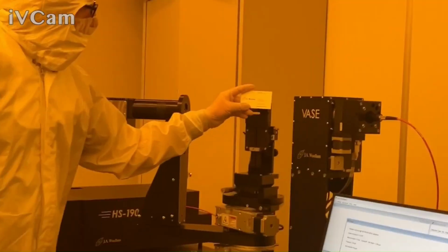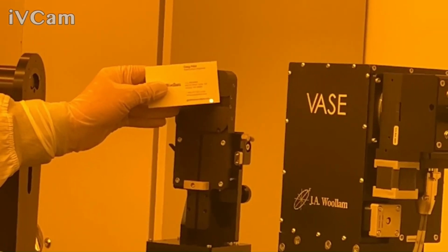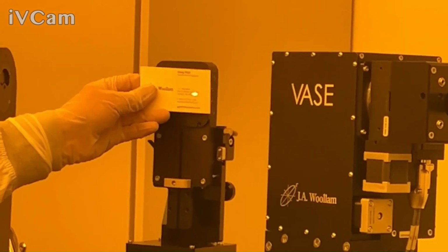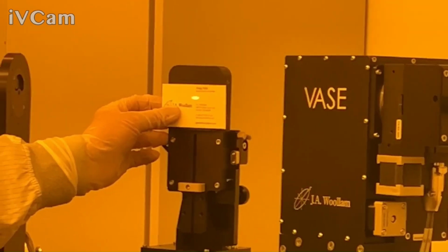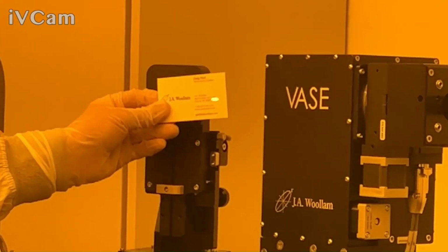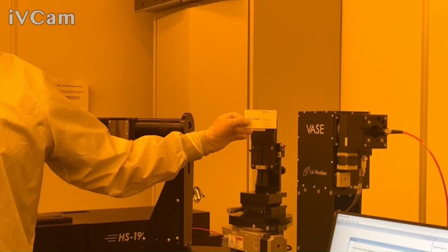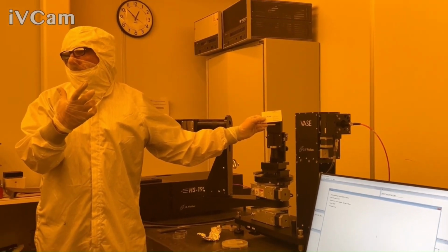And if we look, you can kind of see that. That's the size of your collimated light beam. Okay. So at normal incidence, that's going to be here. But when we're at say 70 degrees, like we are now, it's going to spread. So your measurement area is going to depend on the angle, because as this gets more oblique, it's going to spread. It goes as 1 over the cosine of the angle. So at 60 degrees, the length is going to be twice the width. 70 degrees is going to be about 3 times the width. 75 is going to be about 4 times the width.